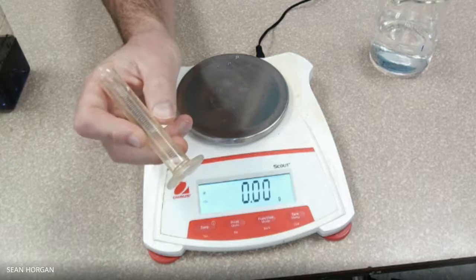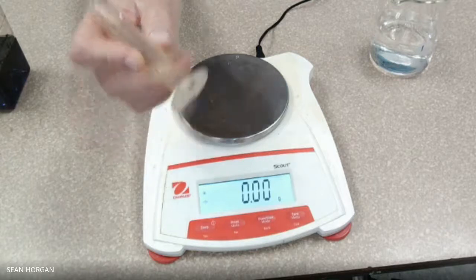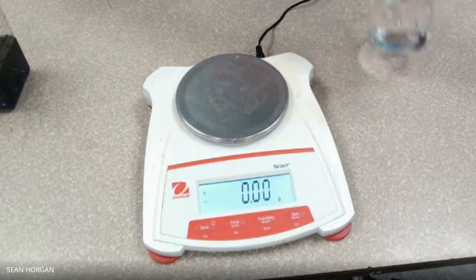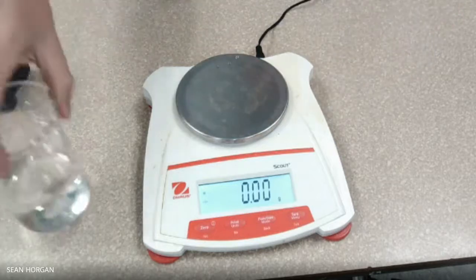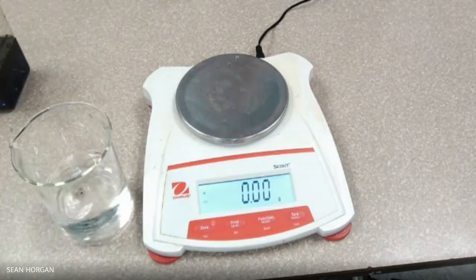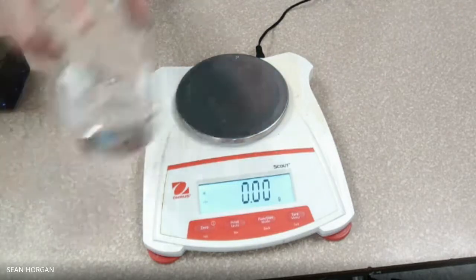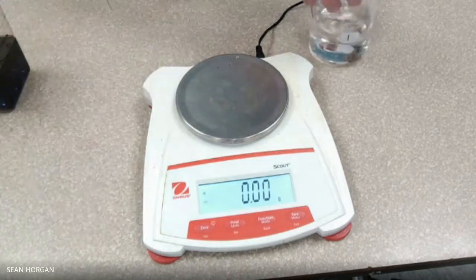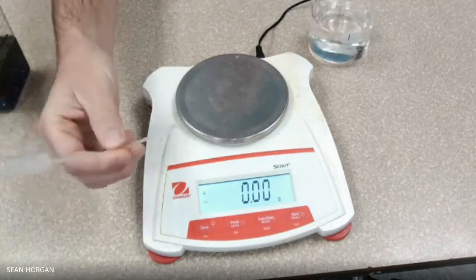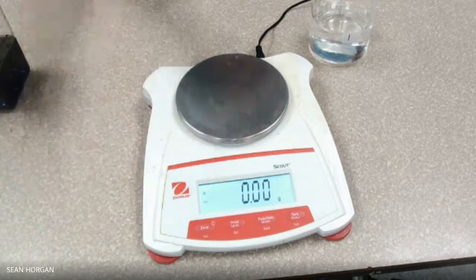And we're going to measure to the bottom of what we call a meniscus. This container is a beaker — we use it to store things or do reactions. And this is a pipette, and we use it to transfer liquid from one container to another.